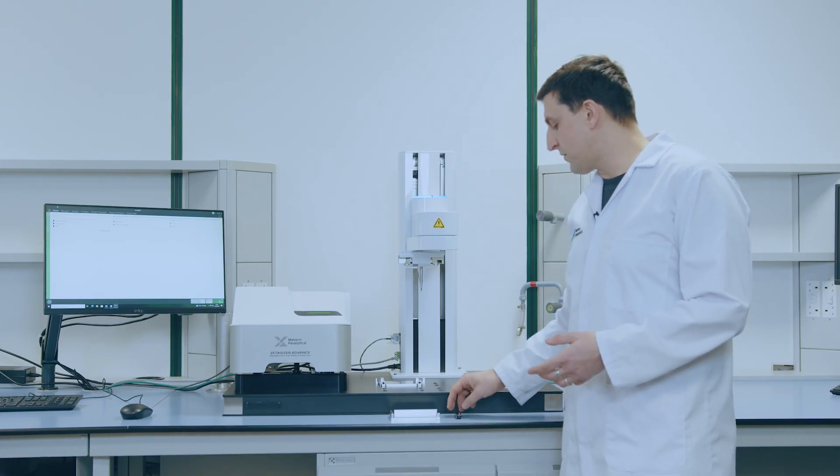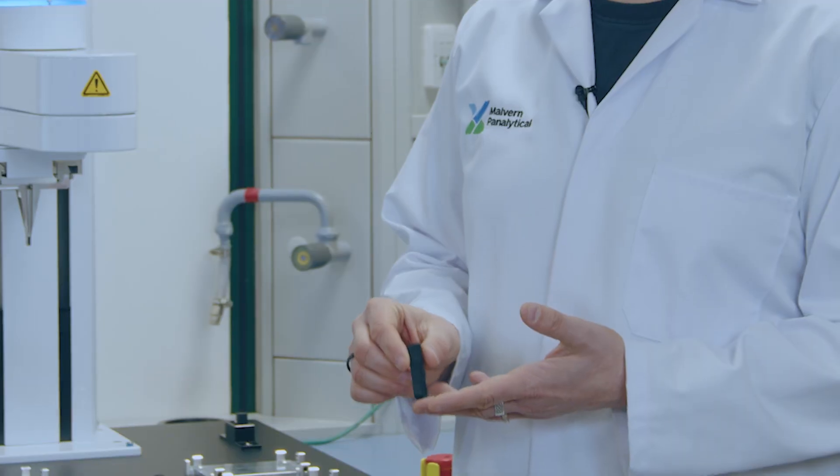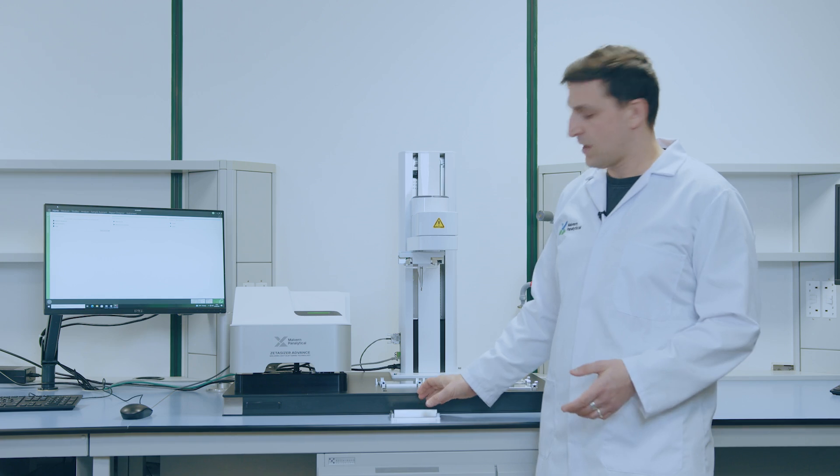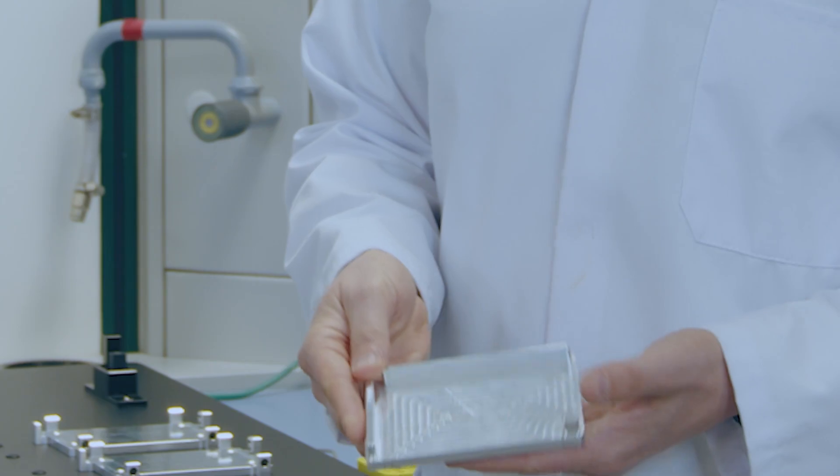For performing the configuration, you will need two tools. The first tool is the datum, which is placed in the tool holder, and the next tool is our calibration bay.